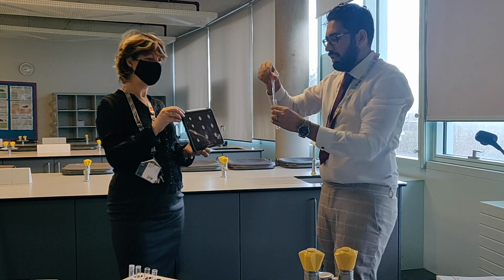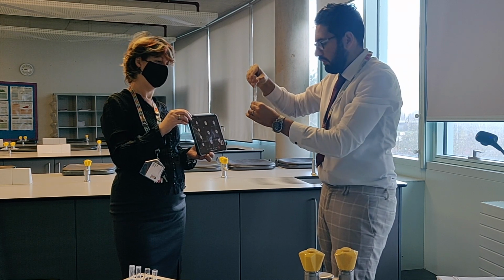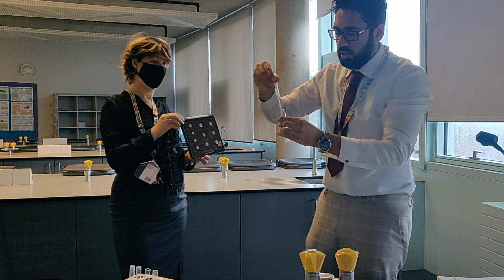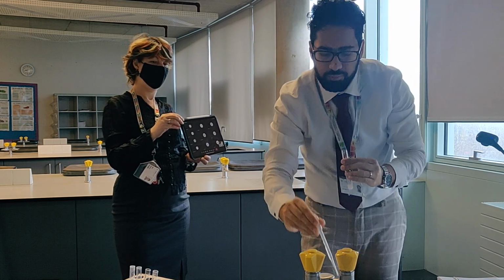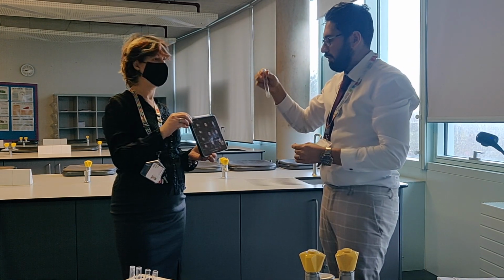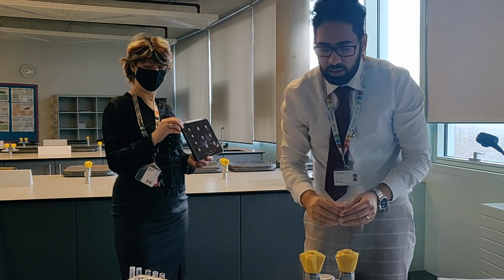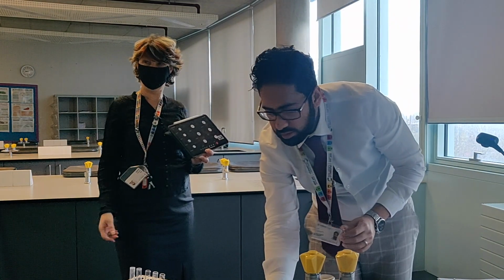And again, I'm going to add it until the sulfuric acid is in excess. So already straight away, you can see from the first few drops that it's already changed compared to the sodium hydroxide. So that was barium chloride with sulfuric acid, and you know that makes barium sulfate, which is insoluble, hence why it's so cloudy straight away. Right. Next, we'll go for calcium bromide.